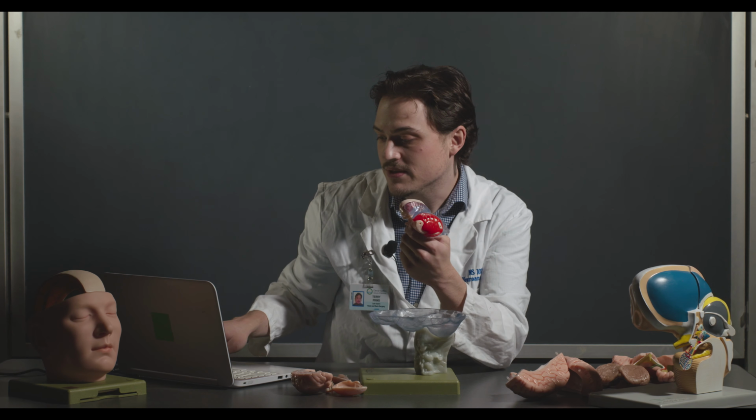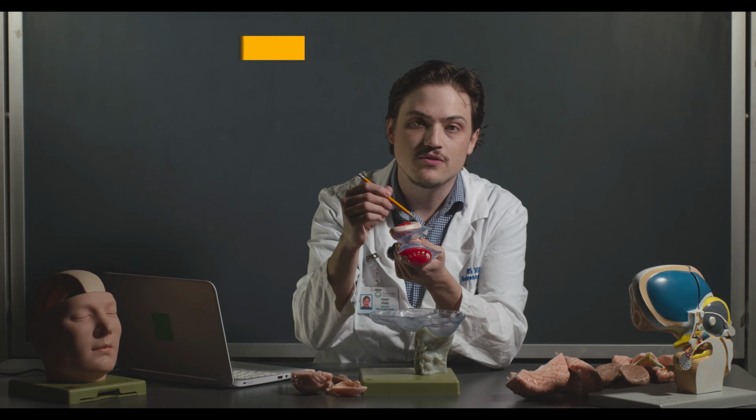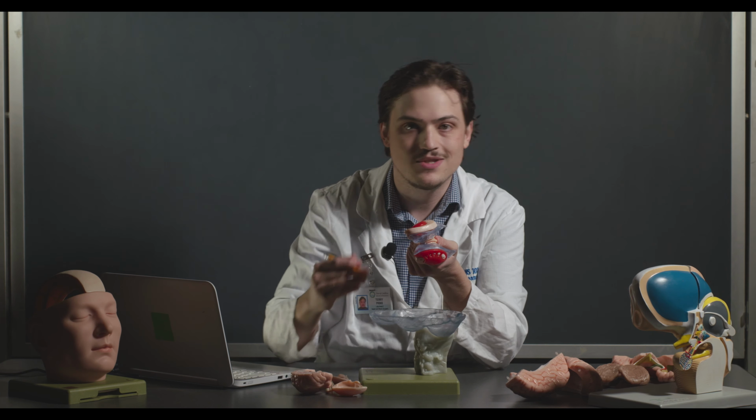So again, in your lab slides, there's a bunch of different cross-sections of brains where a lot of these different structures are kind of labeled. So you can see how it would look in different vantage points in fMRI or MRI or actual brain cuts like axial cuts or coronal cuts. So just be aware of where these structures are in those different cuts as in the lab manual and be able to identify them. If you were given it on the exam, like on the practicum or on a quiz, we would give you the exact images that you see in the lab manual.